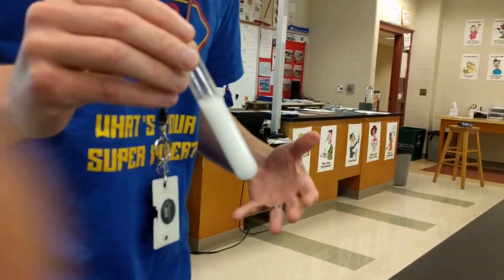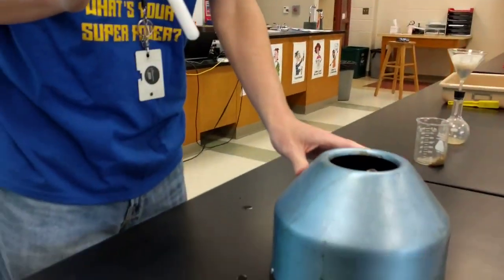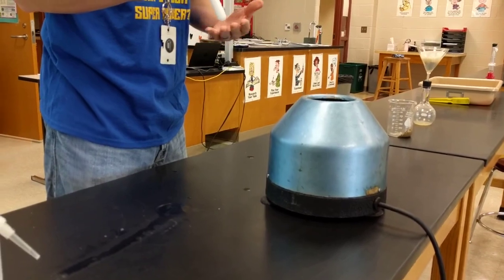Here we have a mixture of cornstarch and water. We're going to use a device called a centrifuge, and the centrifuge is going to separate them based on their densities.